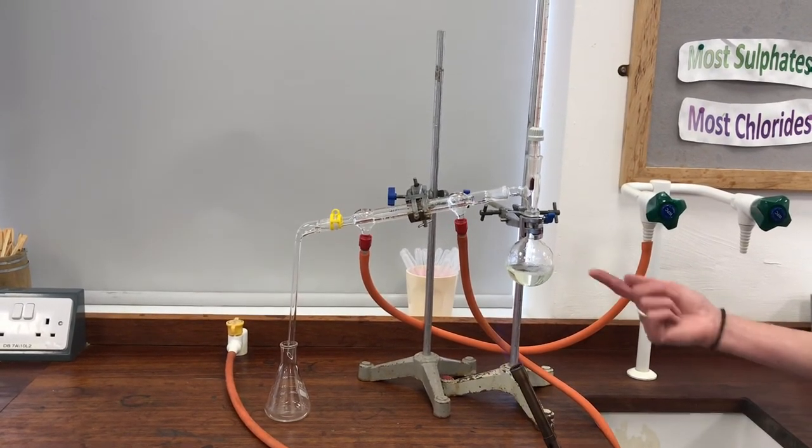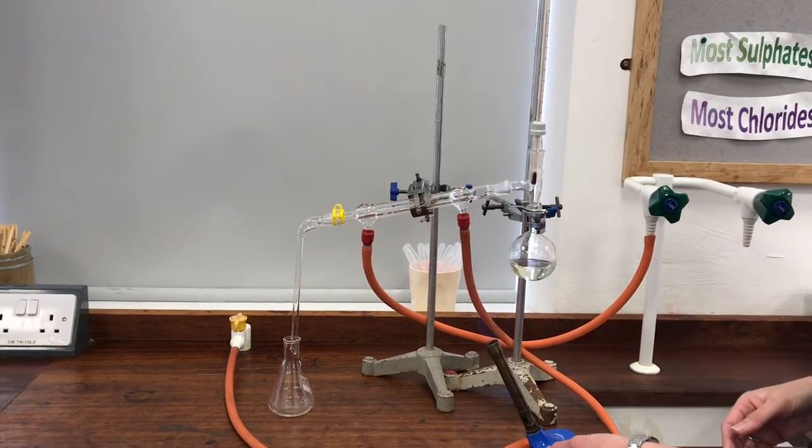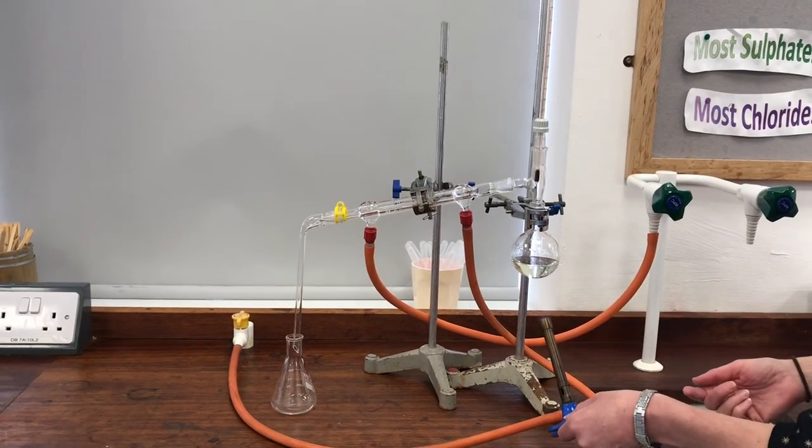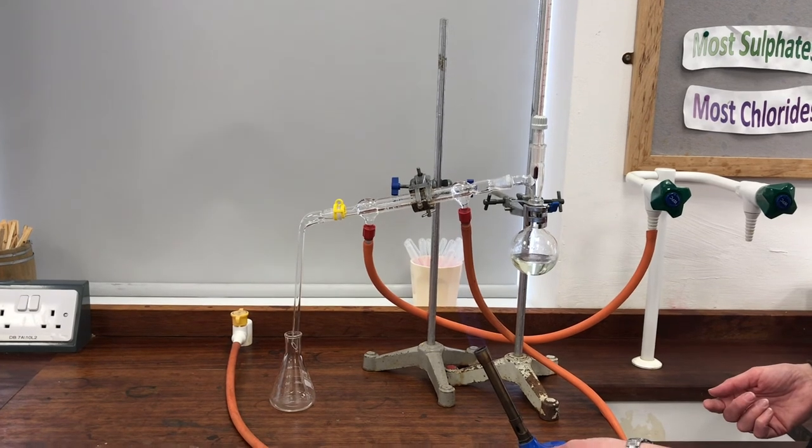And the point when it looks like it's no longer boiling below 80, that will be the point that I shall suspect I've boiled off all my ethanol and I'll be left with pure water in the flask here. I think we're probably getting close to that point right now.